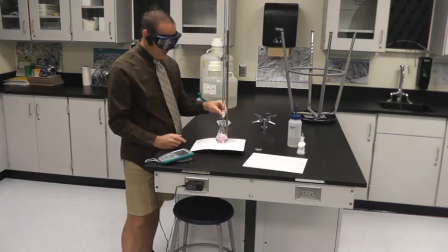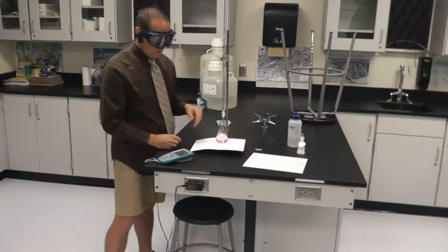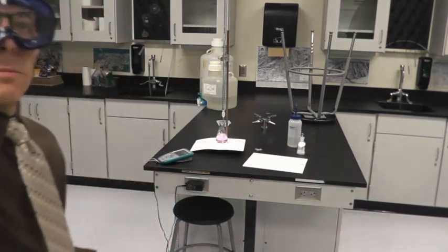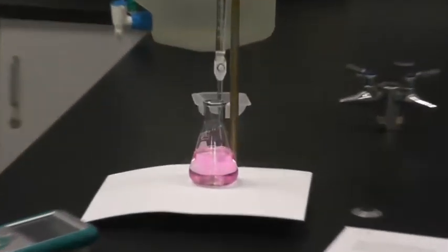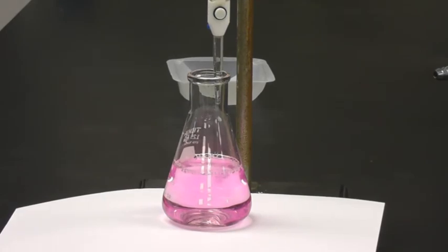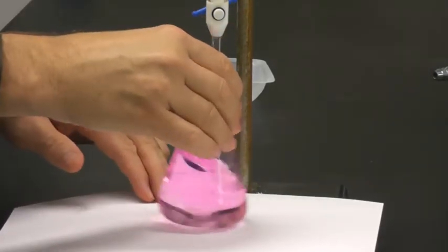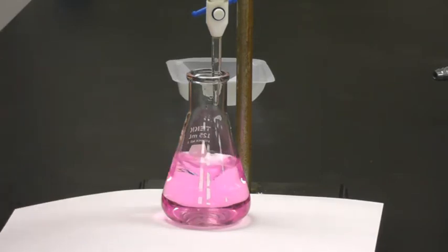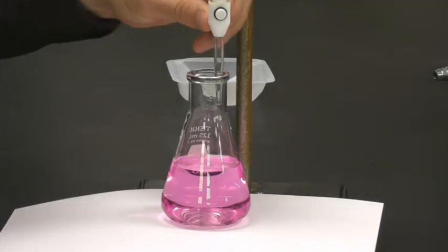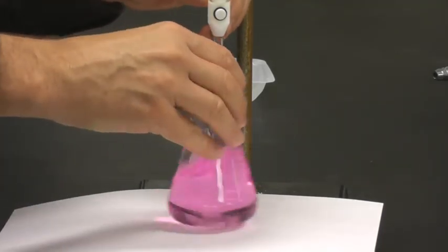If you overshoot it, this is kind of fun, it turns quite pink. And if you go cotton candy pink, that is way, way, way, way too far past the end point. And it can just get pinker and pinker and pinker, but at a certain point it doesn't get any more pink.